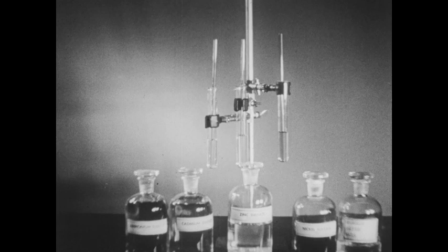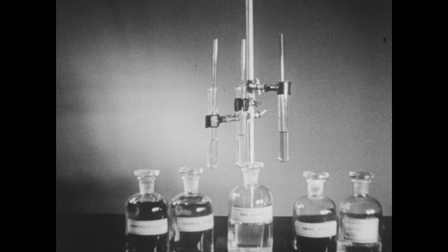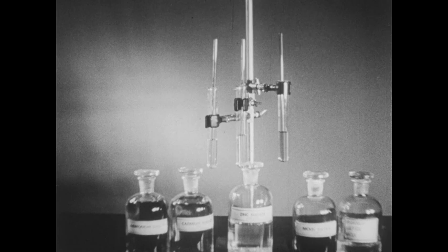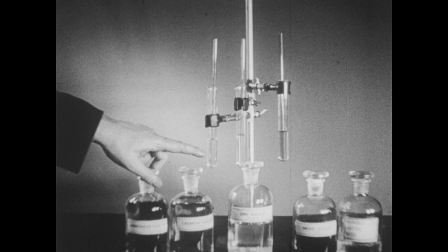This experiment will illustrate the use of hydrogen sulfide water as a precipitating agent. Hydrogen sulfide in water is a very weak acid, meaning the concentration of sulfide ions in its solution is very low. Before this very low concentration of sulfide ions can react with a metal ion to form an insoluble sulfide precipitate, the metal sulfide must be very insoluble. If the metal sulfide is comparatively soluble, an insufficient quantity of sulfide ions will be present to cause precipitation.